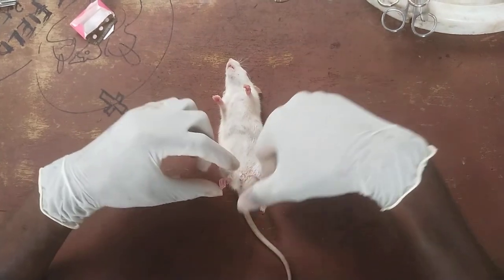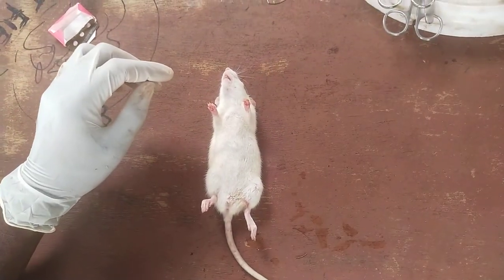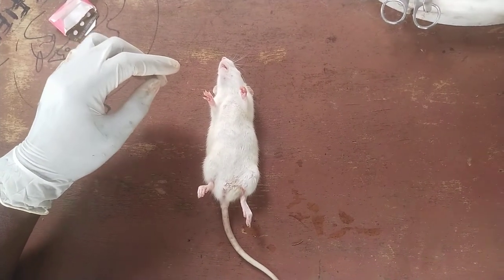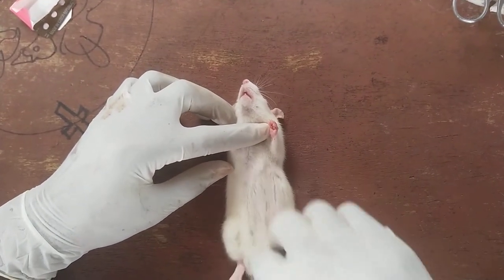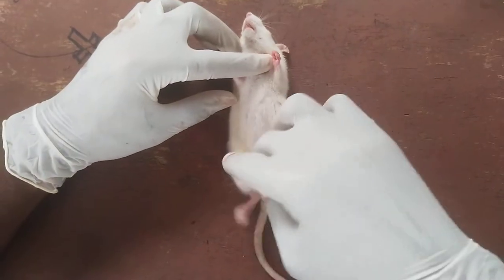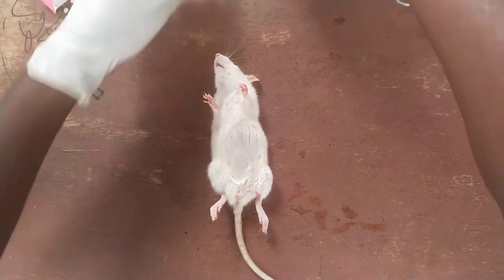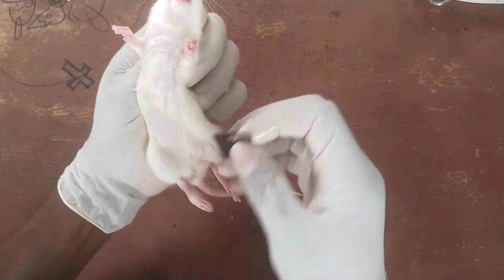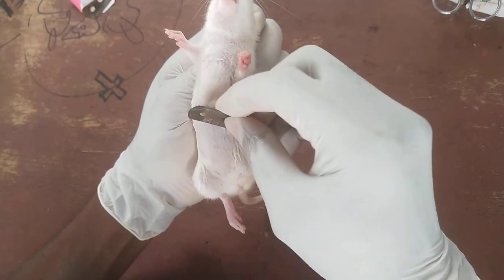The next thing to do is use soapy water to wet the fur over the ventral abdominal region. Make sure it is wet using soapy water, because doing so makes it easier to do your shaving. Lift it up a bit and shave.